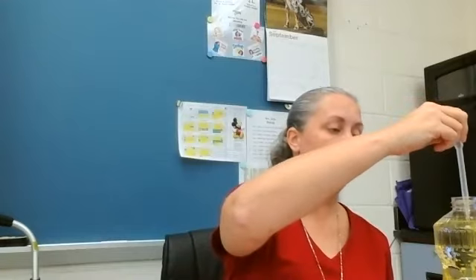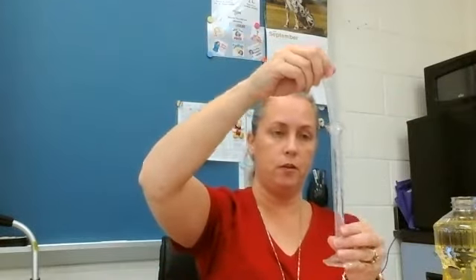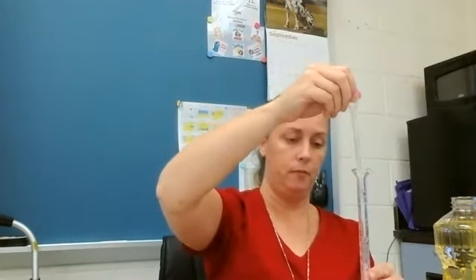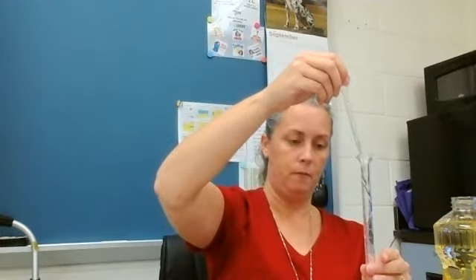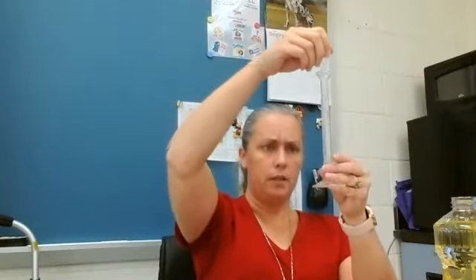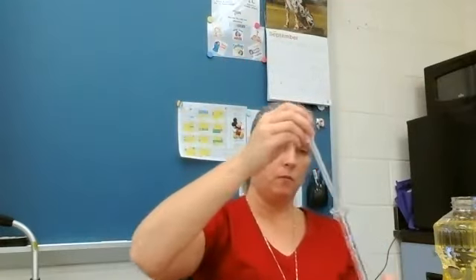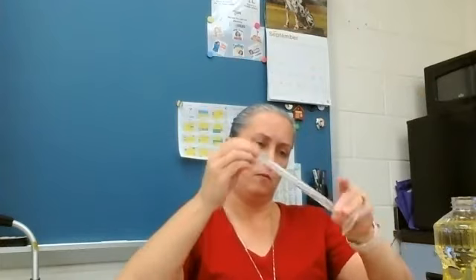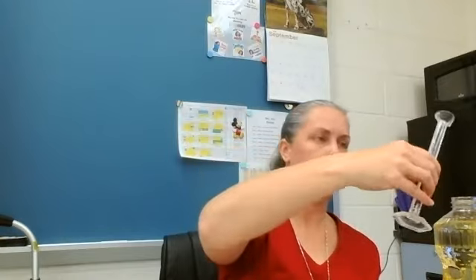I'm going to add two ml of cooking oil. I'm actually going to put it into this graduated cylinder first so I make sure I have exactly two ml. I'm making a mess — I need to take some out, added a little too much. It's not cooperating very well. Just a second to pour a little bit back out. And now I don't have enough. Gotta love science.